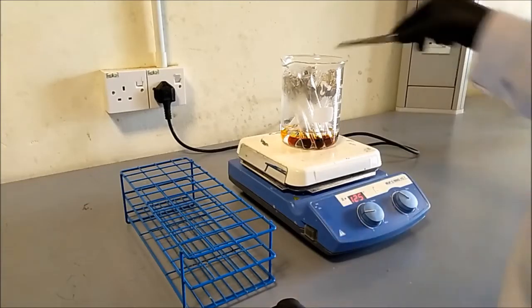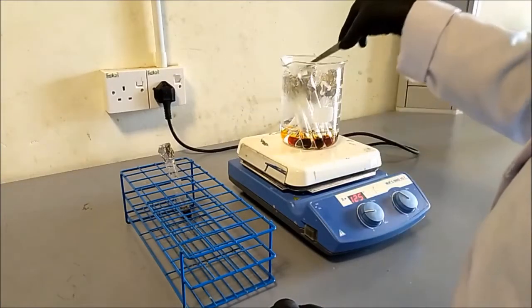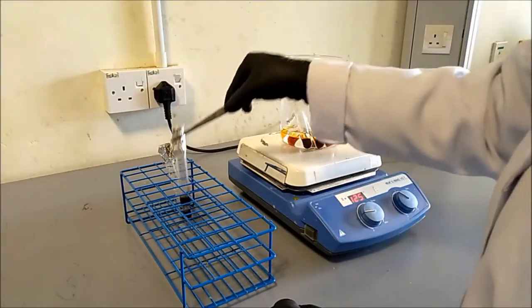After boiling, take out the test tubes. Let the test tubes cool down to room temperature.